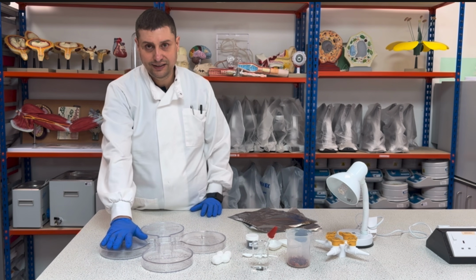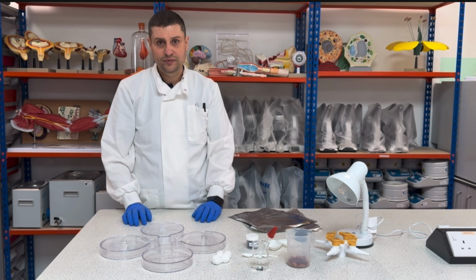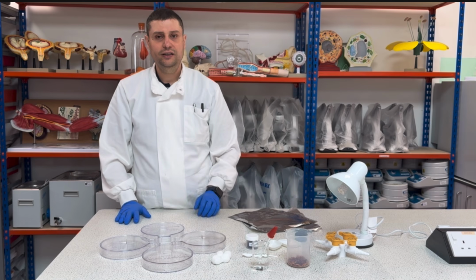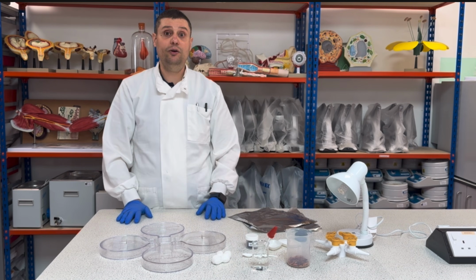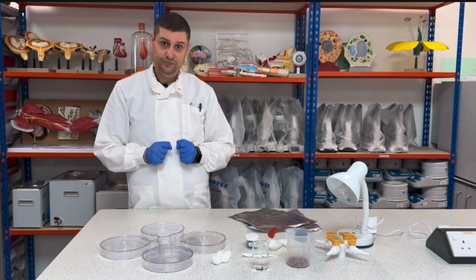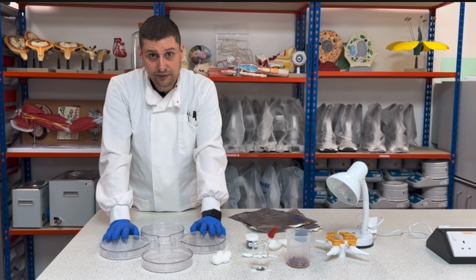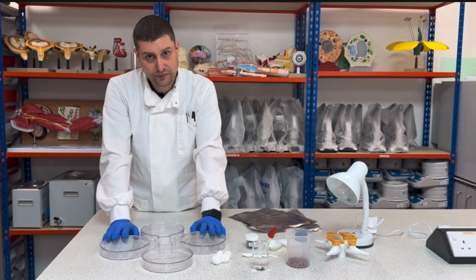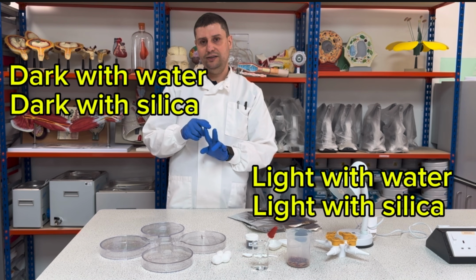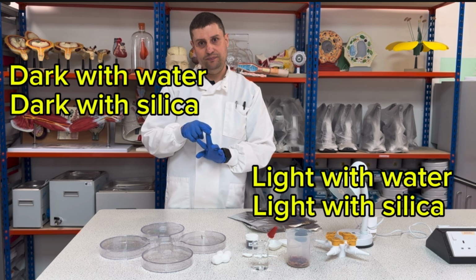So how am I going to delimitate? I'm going to do one light, one no light, one light, one no light. And from the light, I will take one with water, the other one with silica. Silica will take all the moisture off, so the air there will be dry. The other ones will be one with water, one with silica again. So we're going to have dark with water, dark with silica, light with water, light with silica.